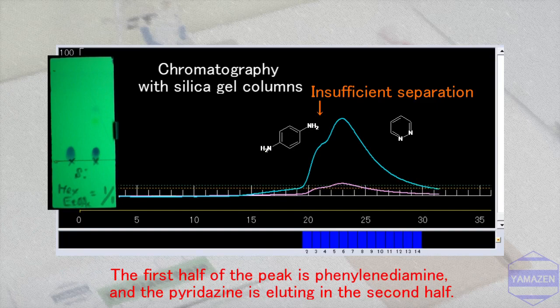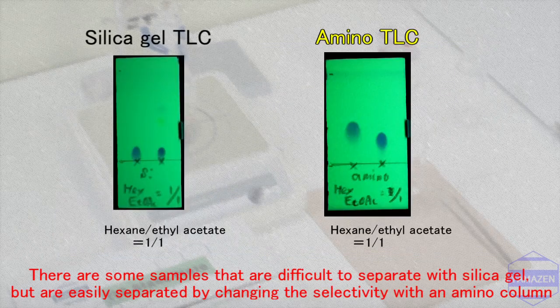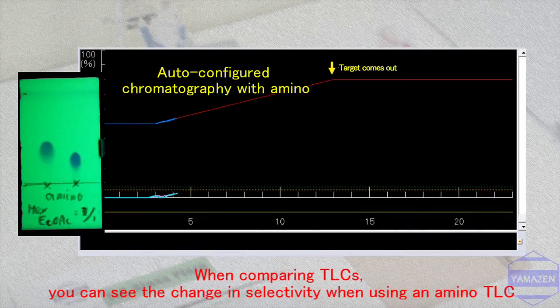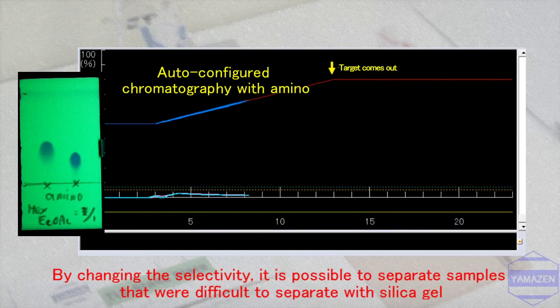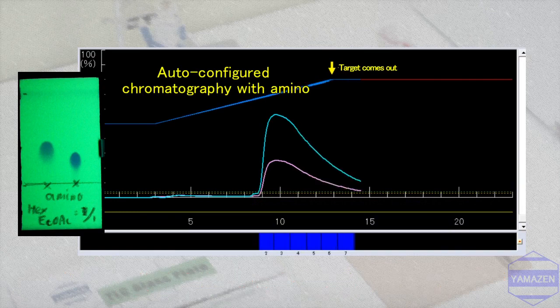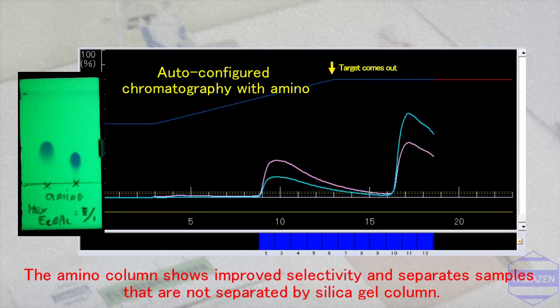These samples are difficult to separate with silica gel, but are easily separated by changing the selectivity with an amino column. When comparing TLCs, you can clearly see the change in selectivity when using an amino TLC. By changing the selectivity, it is possible to separate samples that were difficult or impossible to separate with silica gel. The amino column shows improved selectivity, separating these samples when silica gel could not.